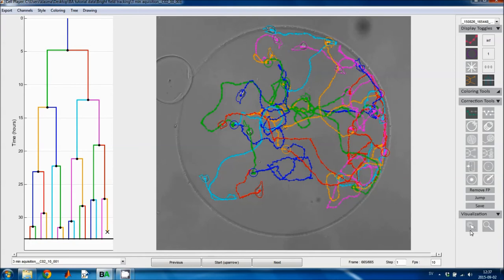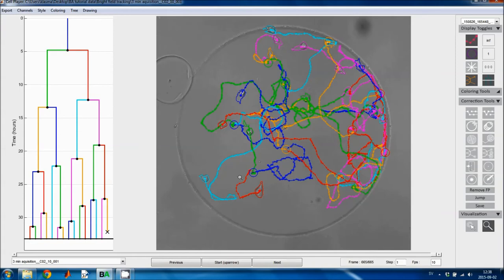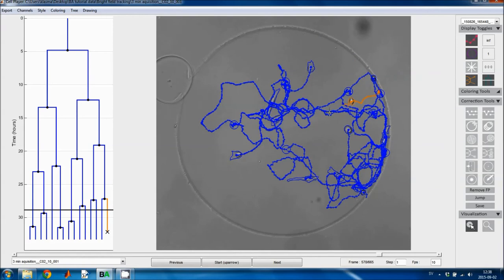And then we've got some visualization tools. This magnifying glass just turns the zoom tool on and off. In all other players this tool is on by default, but in the track correction interface you need to turn it on. And then this selection tool allows you to identify tracks between the image and the lineage tree. So if I want to know which cell is which, I can click on the cell in the image, and then the cell is highlighted in orange, both in the image and in the lineage tree. And I can also click on a cell in the lineage tree and highlight it in the image like this. This is useful mostly if you have a lot of cells, so that the colors are not enough to identify the cells.